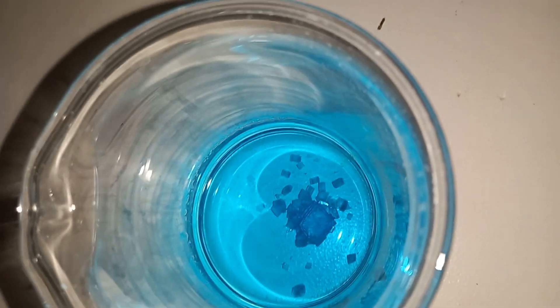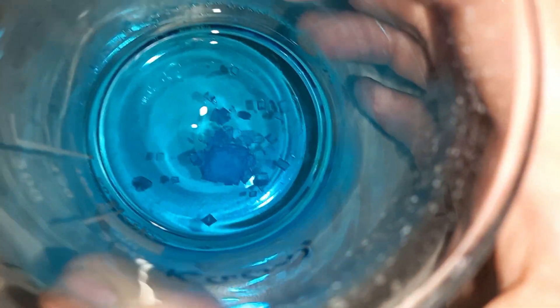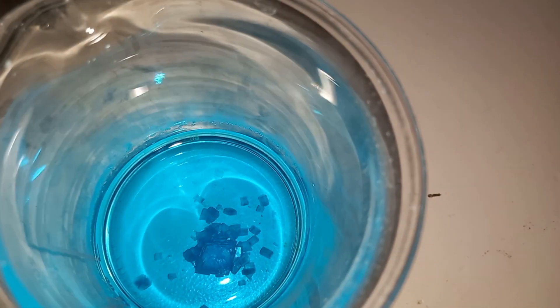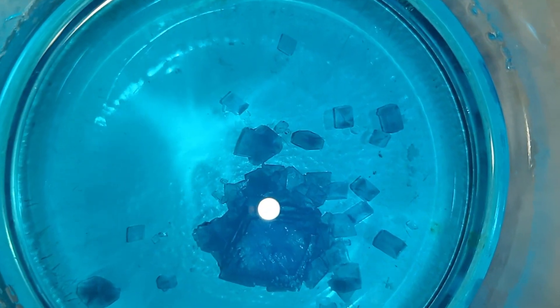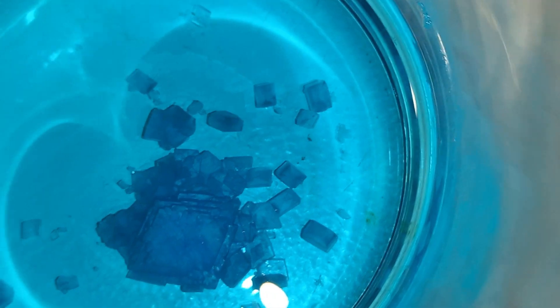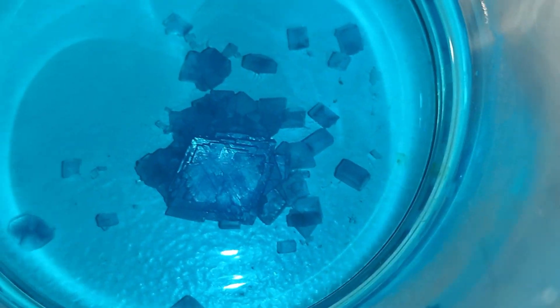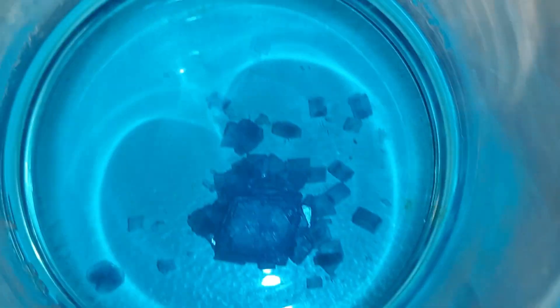Here's the solution a day later, after letting it slowly cool. And there are crystals in there. They are kind of shaped like copper sulfate, but definitely have a weird different quality to them — they have those weird cross shapes in them that your normal salt does when you crystallize it, which is cool and interesting. Also it grows extremely fast, because this morning there was only just the middle piece, and now a few hours — like two, three hours later — there are all these other little crystals growing.